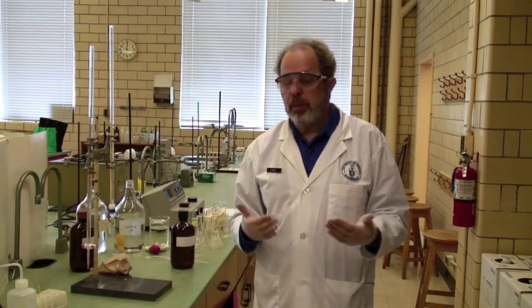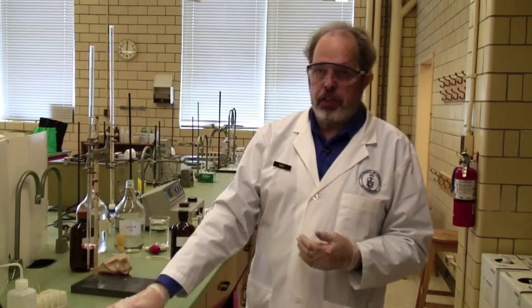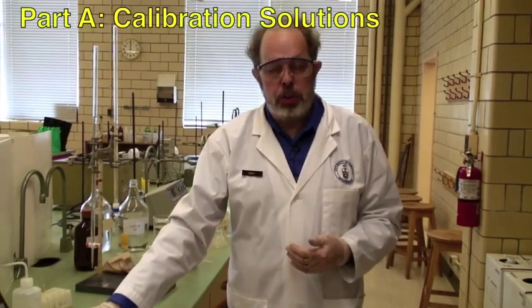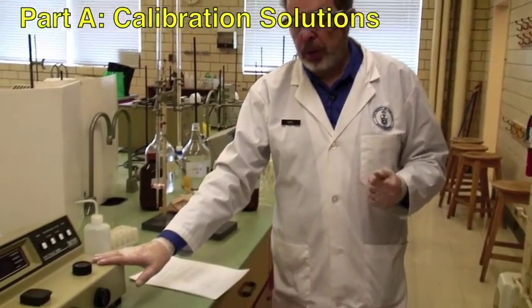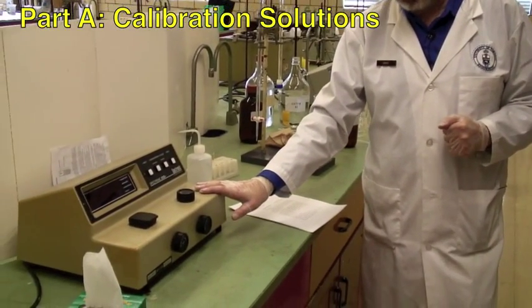The solutions, when you mix them, look like water, and as time passes they will get browner and browner. You'll be monitoring that using a spectrophotometer, which you've already encountered in previous courses.